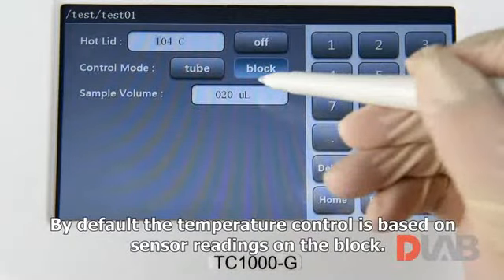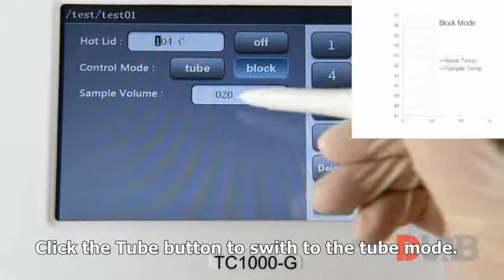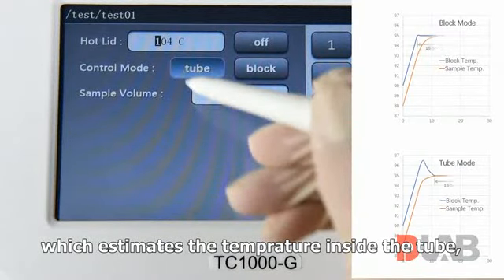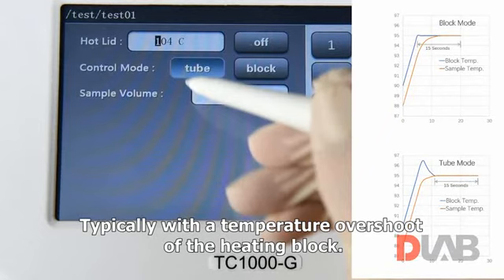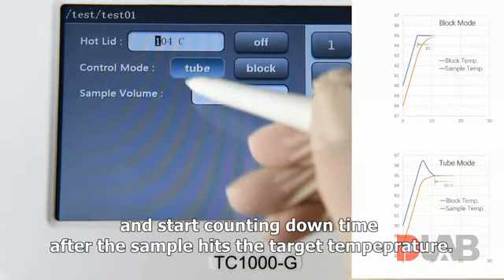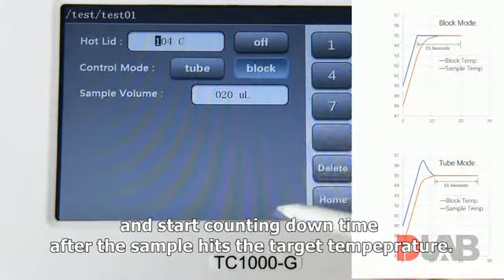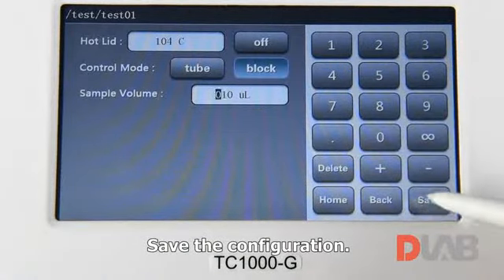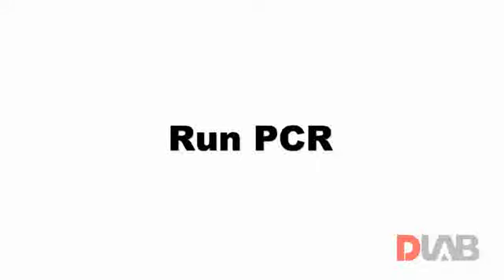By default, the temperature control is based on sensor readings on the block. Click the Tube button to switch to Tube mode, which estimates the temperature inside the tube, typically with the temperature overshoot of the heating block, and start counting down time after the sample hits the target temperature. Set the actual sample volume. Save the configuration. Save the program. Run PCR.